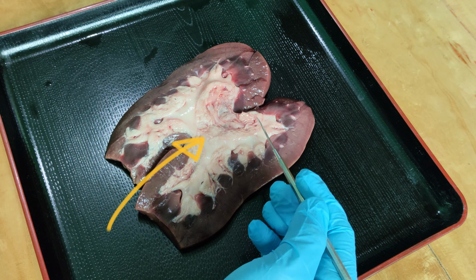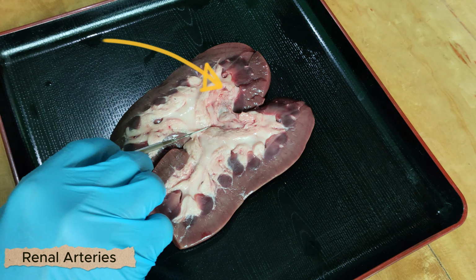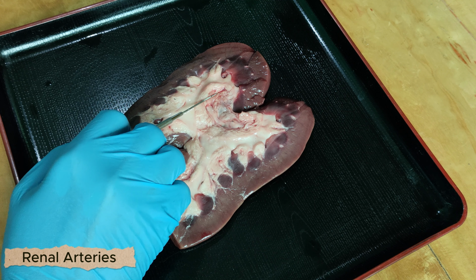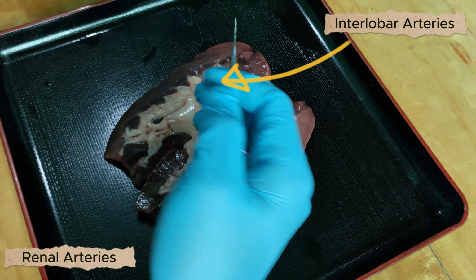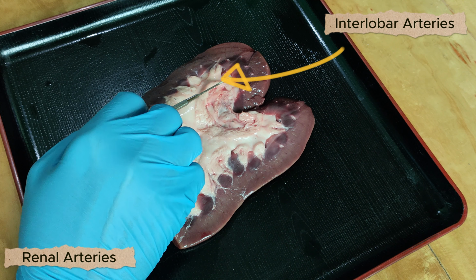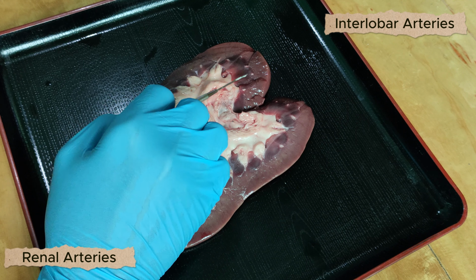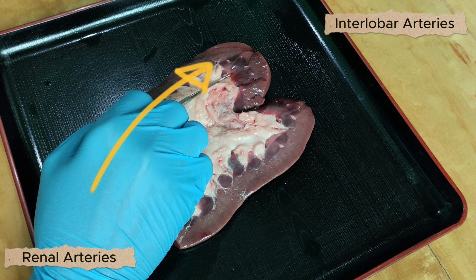Now, the unfiltered blood enters the kidney through the renal arteries found in the hilum region here, where it branches off into the segmental arteries. Then it travels along the spaces between the renal pyramids, known as the renal columns, where these blood vessels are known as the interlobar arteries. After that, it splits off toward the base of the renal pyramids, and these are known as the arcuate arteries.